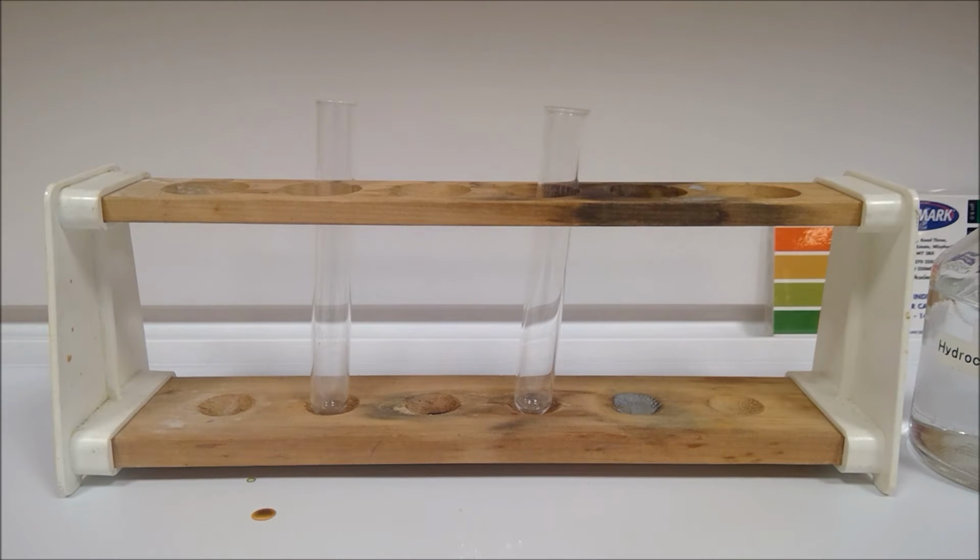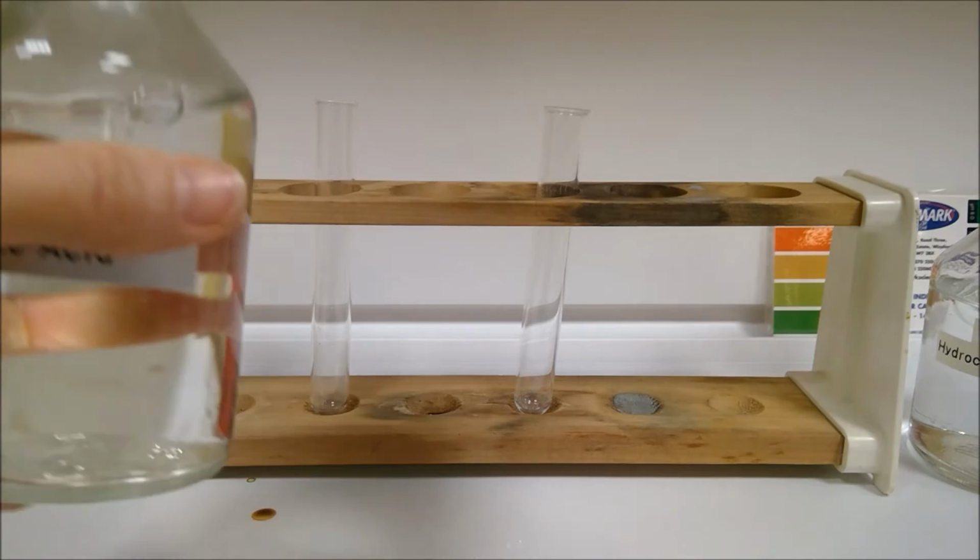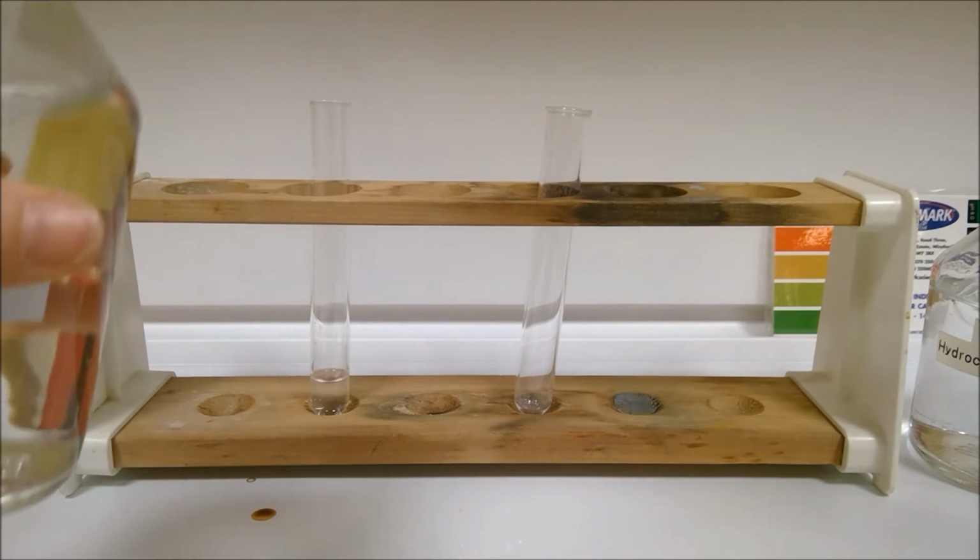Now for part 2, we're looking at what is an acid. So in A, we're making some carbon dioxide by putting sulfuric acid in a test tube and then adding some sodium carbonate. So think about your typical acid reactions.